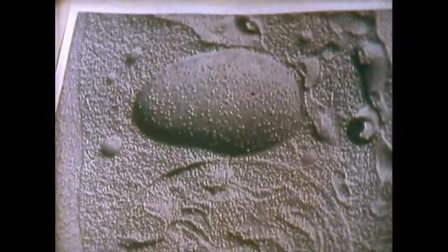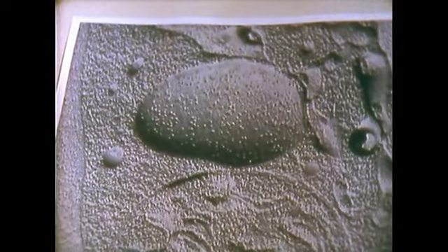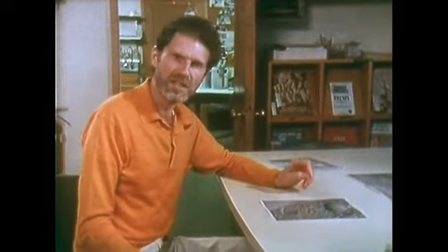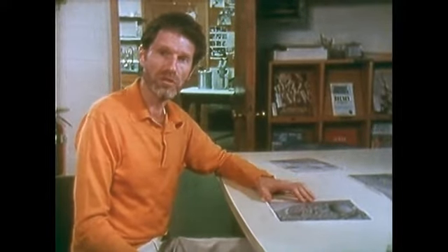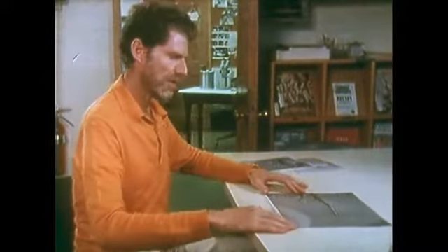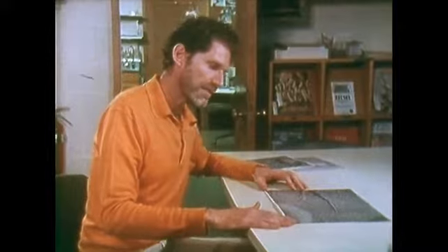We can see these better on this vesicle. Here, in this vesicle that's protruding from the surrounding cytoplasm, we can see bumps. At first, we didn't understand what those bumps were, nor did we really understand what the fracture faces were. And the first indication of what was going on came by examining electron micrographs showing membranes that had been cross-fractured in one region and face-fractured in another region.